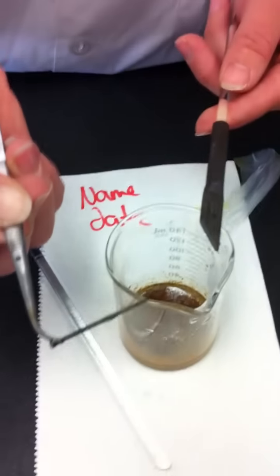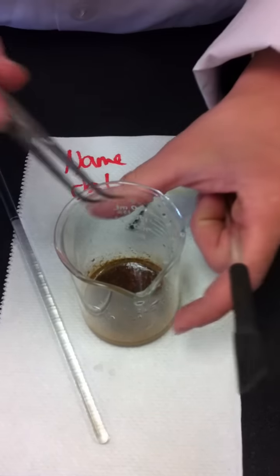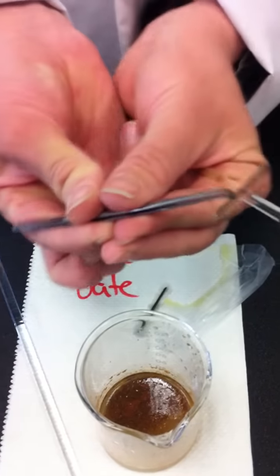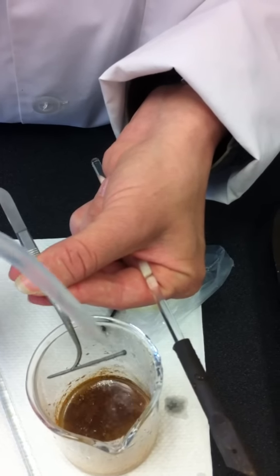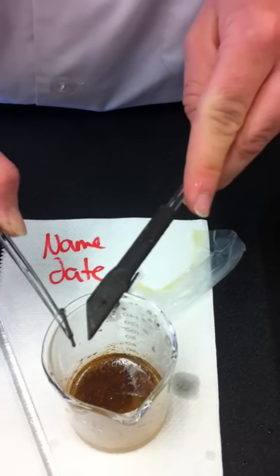I've rubbed it off. I've rinsed it. I'm going to put it on my paper towel with my name and date on it, and I'm going to dry that so all the liquid will evaporate and we can get a mass on that tomorrow. I'm going to wash this one off. So washing into the beaker because there's little bits of precipitate on here that we want to collect in our filter apparatus. Yeah, that looks clean too.